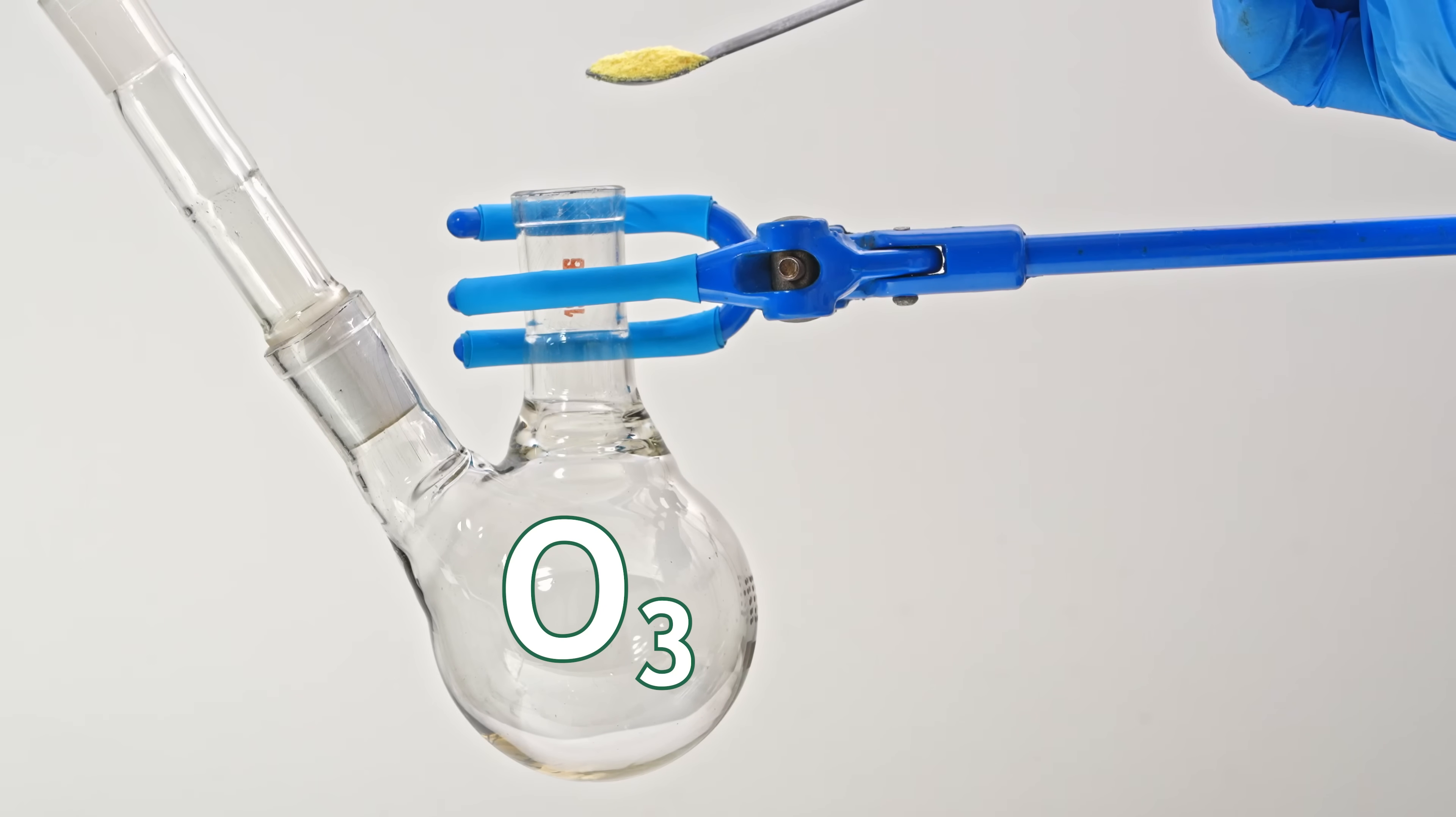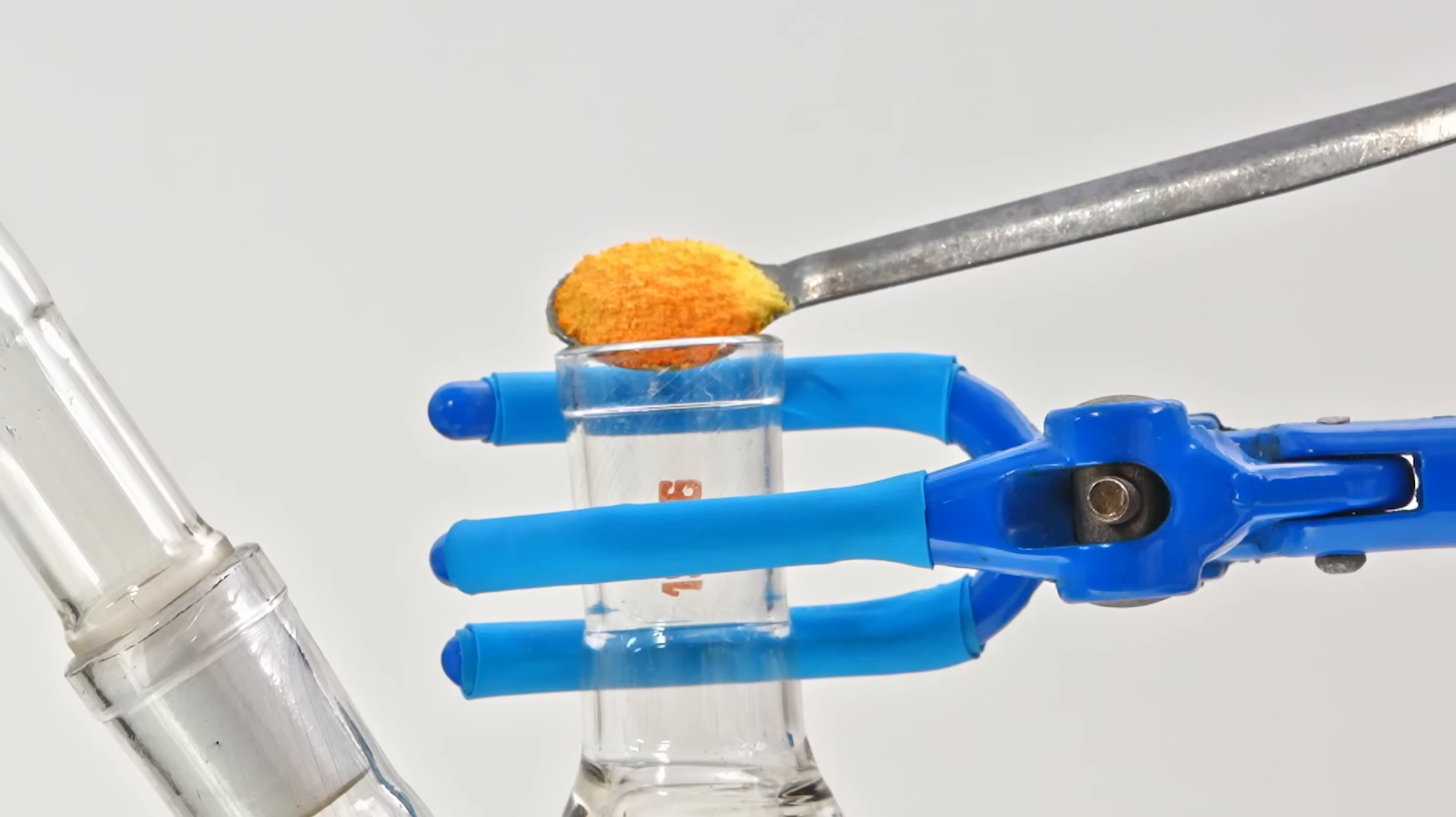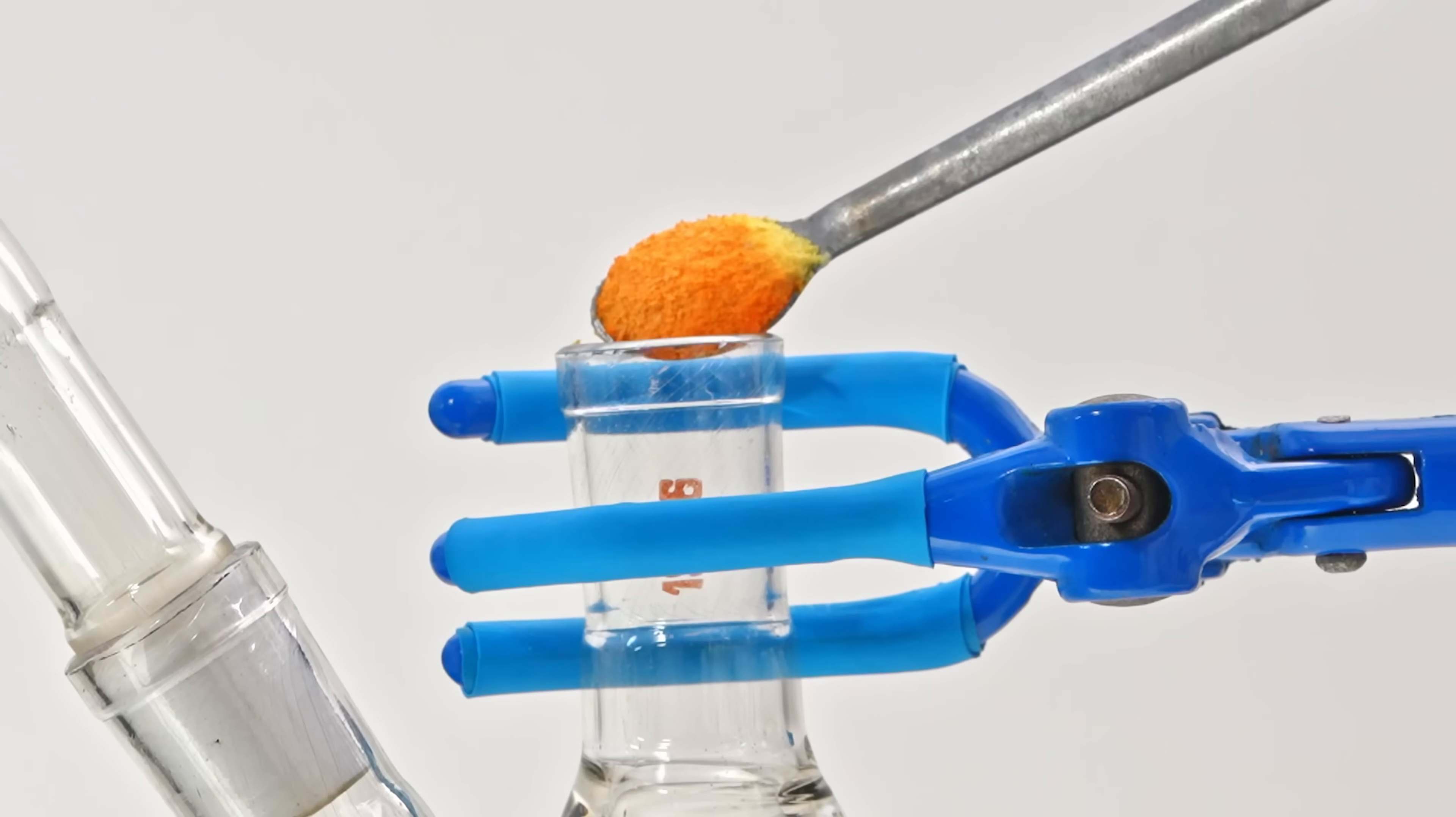Here is another demonstration. See how the yellow potassium superoxide turns red when added to a flask filled with ozone.